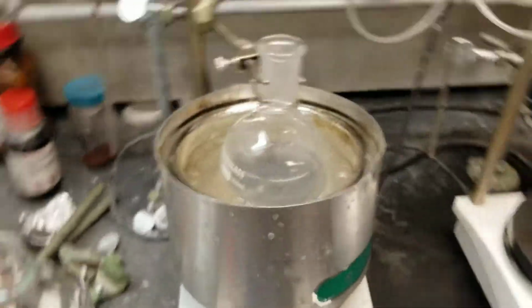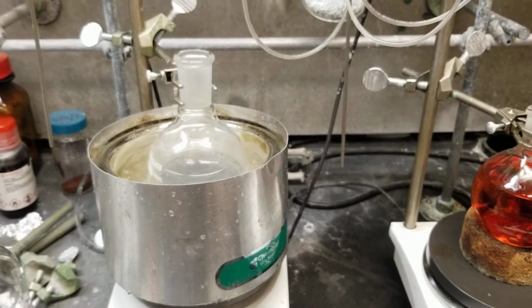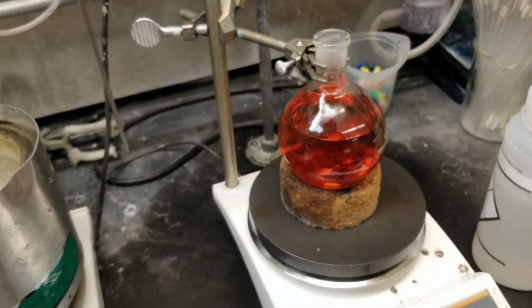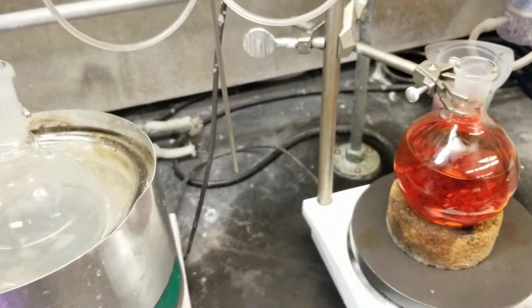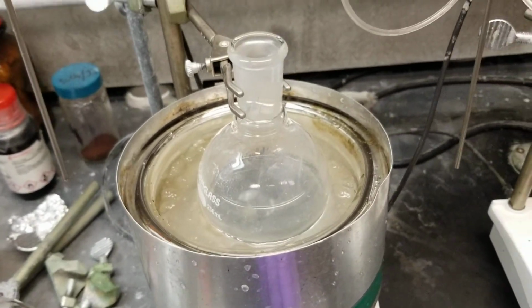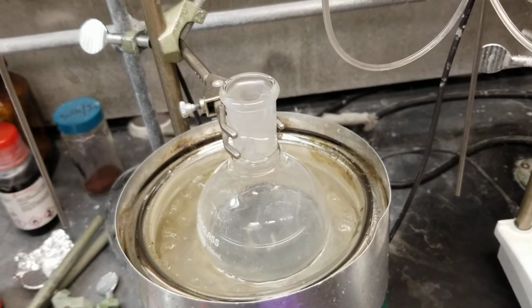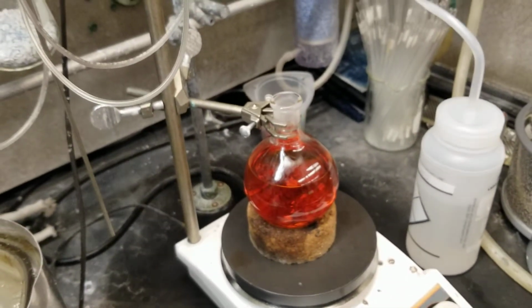So here, I have a case where I'm running two reactions at once, and I'll show you the differences in the way they behave, and why they end up behaving this way. In one case, I'm getting ready to work these up, and you can see that I have my material here on ice. That gives you some hint as to which one of these is going to be a little bit more aggressive during the workup, whereas the one at room temperature perhaps might be a little bit more reasonable to handle.